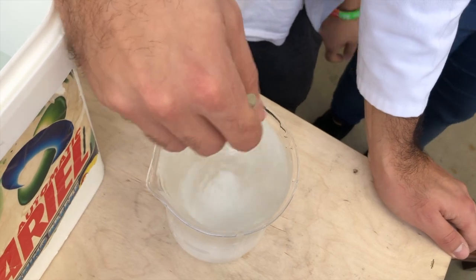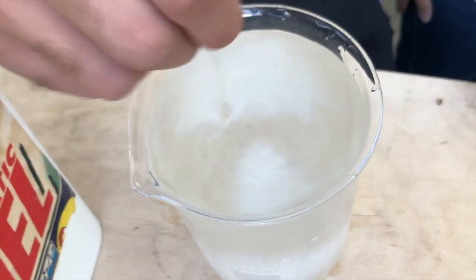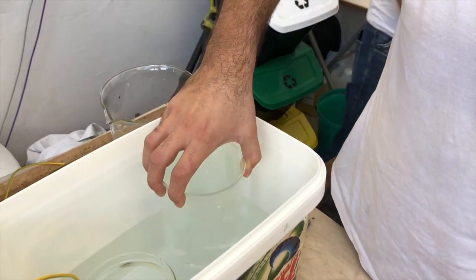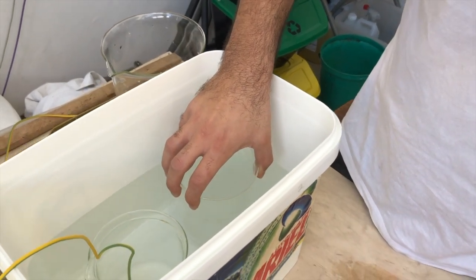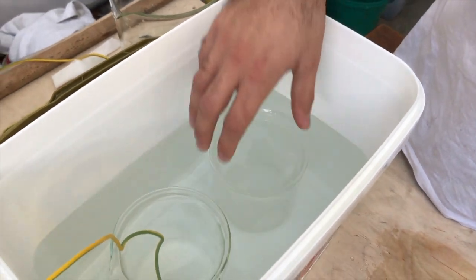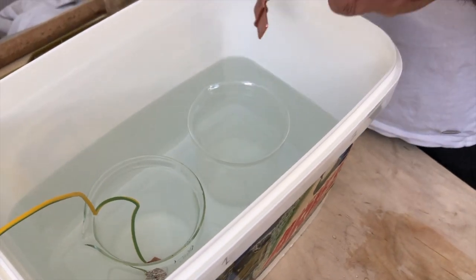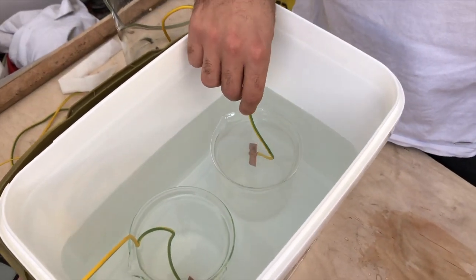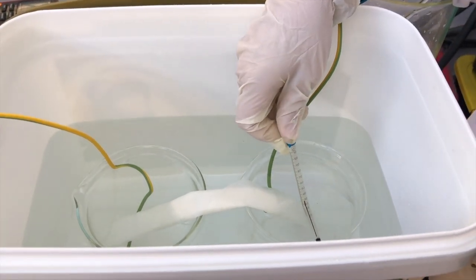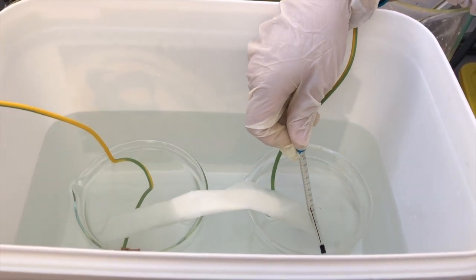The level of agitation does affect the voltage produced. If the number of turns is increased with an automated or mechanical device, the passive region could be reached. Since in our case only people agitated the solution, only low voltages were produced, keeping our copper in the corrosion region. When the passive region is reached, the rate of corrosion is reduced drastically. Therefore, the copper would be in better operating conditions. The best operating conditions would be the immunity region, where the copper is thermodynamically immune from corrosion.